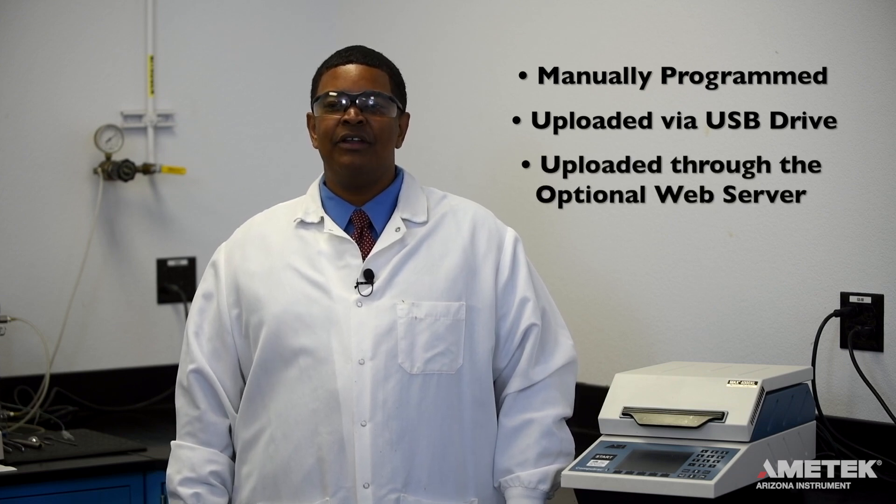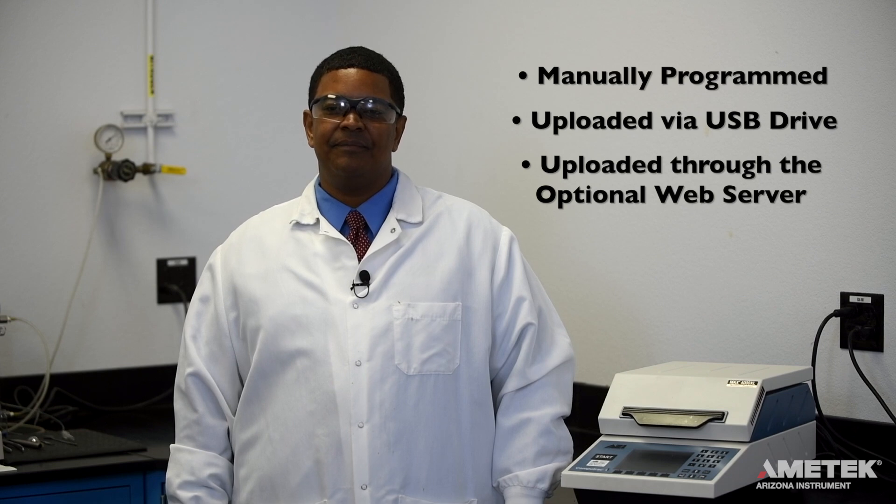There are three ways in which test programs can be added to the instrument: they can be manually programmed on the instrument, they can be uploaded via USB flash drive, or they can be uploaded to the optional web server. Please note that the web server is only available on the Max 4000 XL, not the Max 4000.